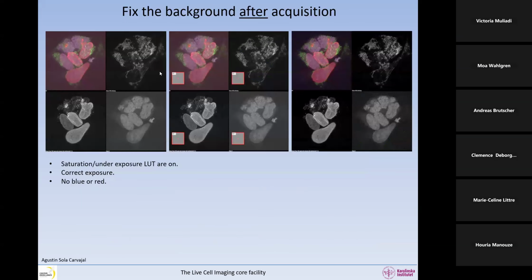Once you have those images, even if you are not happy because they have some sort of high background, which comes in this case from the mounting medium being autofluorescent, you can fix this after acquisition. So please acquire your images in the correct way. That can be fixed afterwards. But if you acquire them with saturation and underexposure, it cannot be fixed afterwards. So here we have the correct exposure, and there's no red and blue. And then we can select here an area in the background and then subtract this. So we can acquire images without underexposure on a single point confocal like this one.